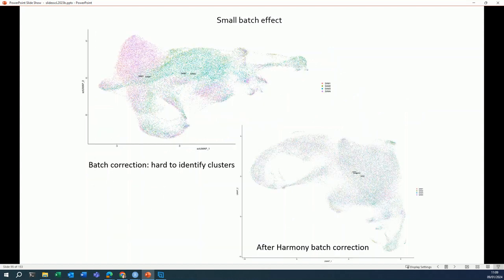Most often you will see something like this here. So there is a shift. You have only purple colors here, and here on this side, you only have blue and green colors. So there is a shift between the samples, but it's not as bad as it was here. Here again, you think about the setup of your experiment. If you expect a small batch effect, the samples were handled by different people. They were harvested on different days. They were sequenced in different lanes of the flow cell. So if you see reasons for a batch effect, you can do a batch correction.